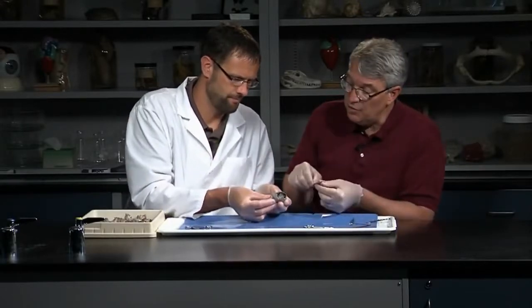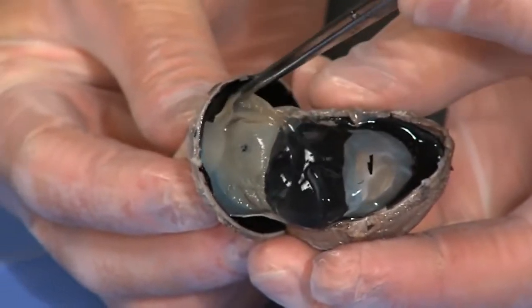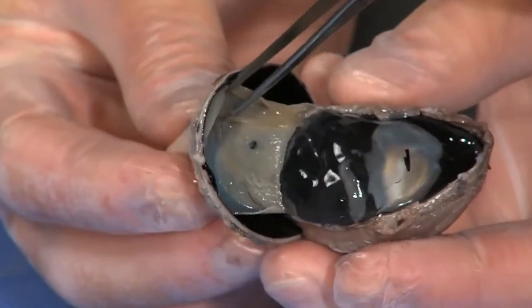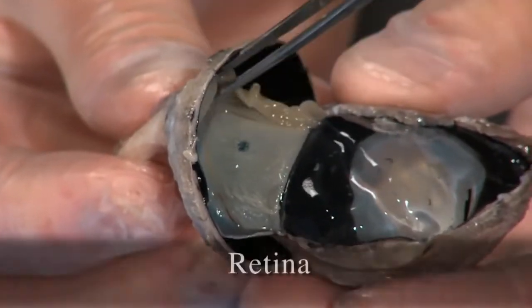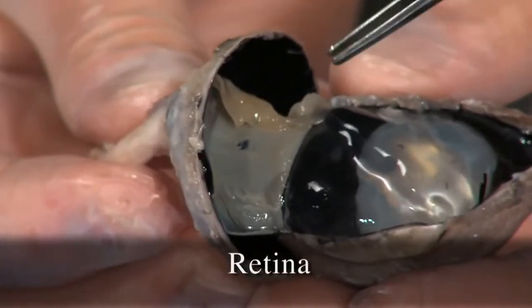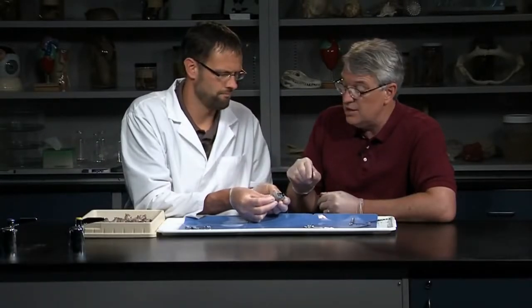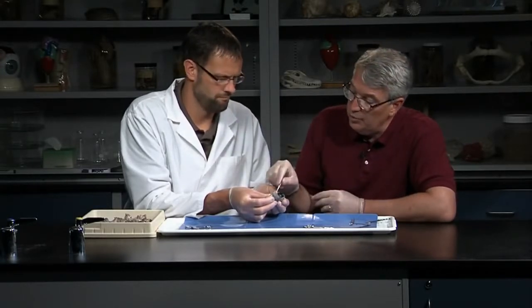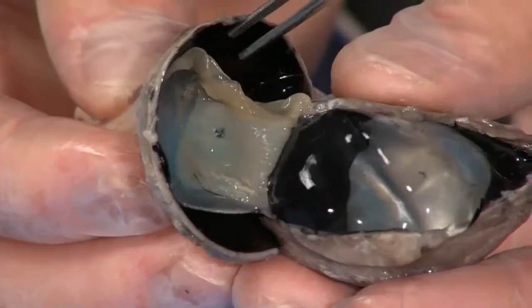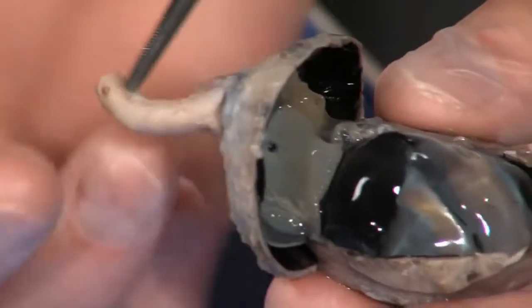If you look here, you see this kind of translucent, almost flesh-colored layer against the back of the eye. That's the retina. The retina has the photoreceptors — that's where the light hits and is interpreted as photosignals. The rods and the cones: cones more for color vision, rods for black and white. Those signals are turned into electrical signals which are transmitted into the optic nerve.